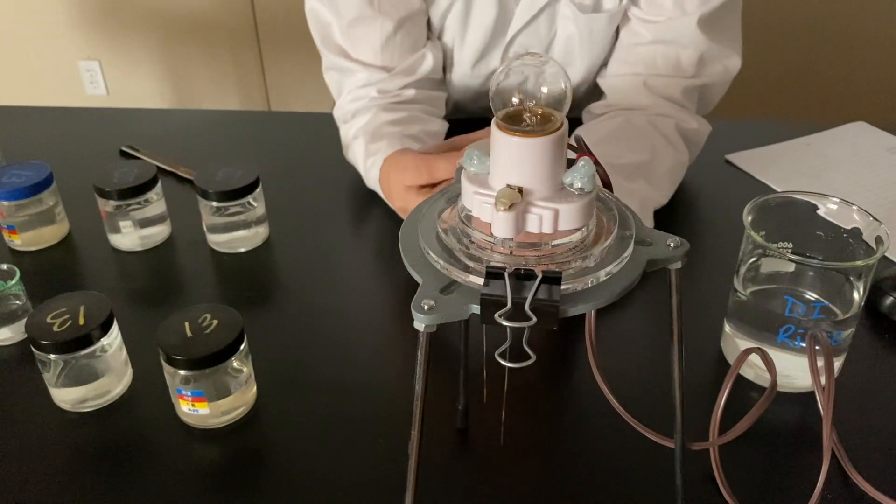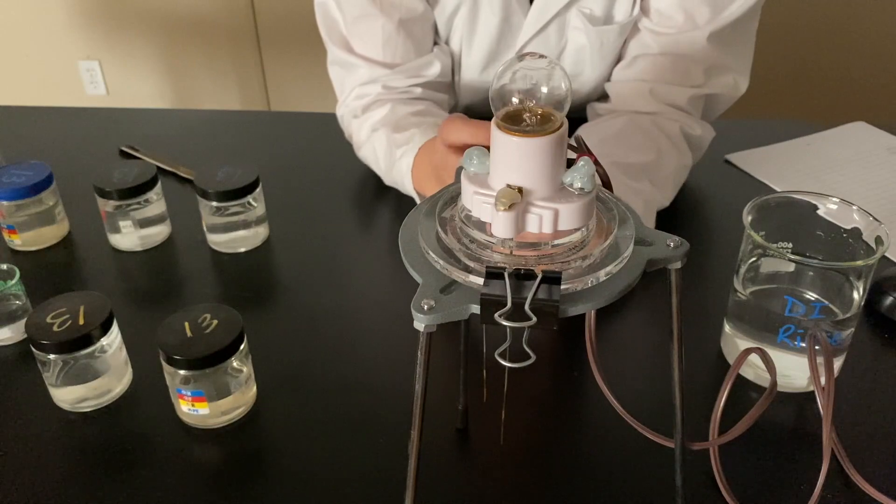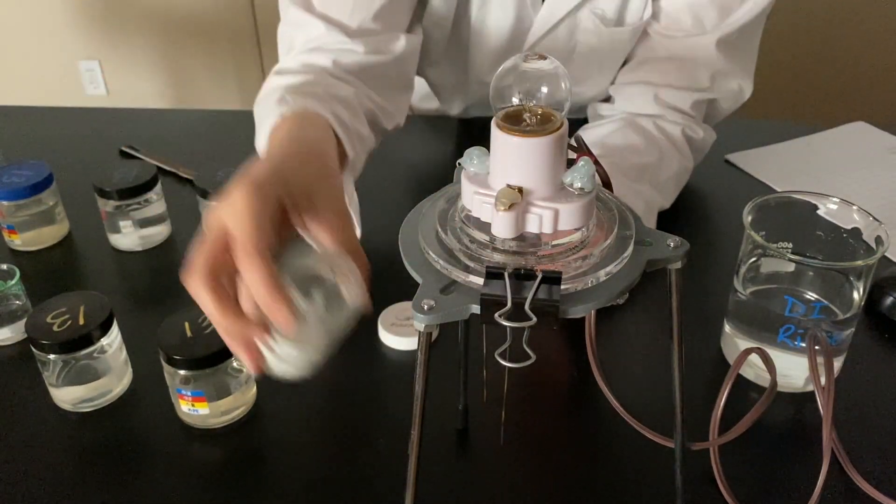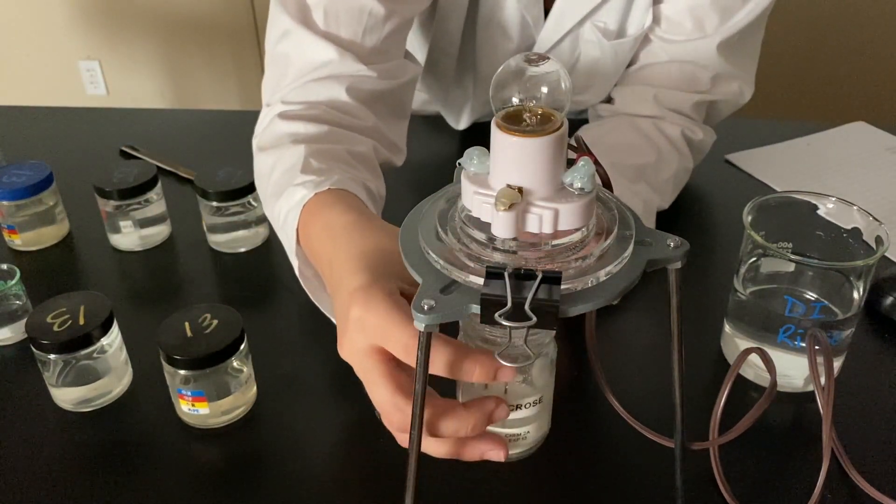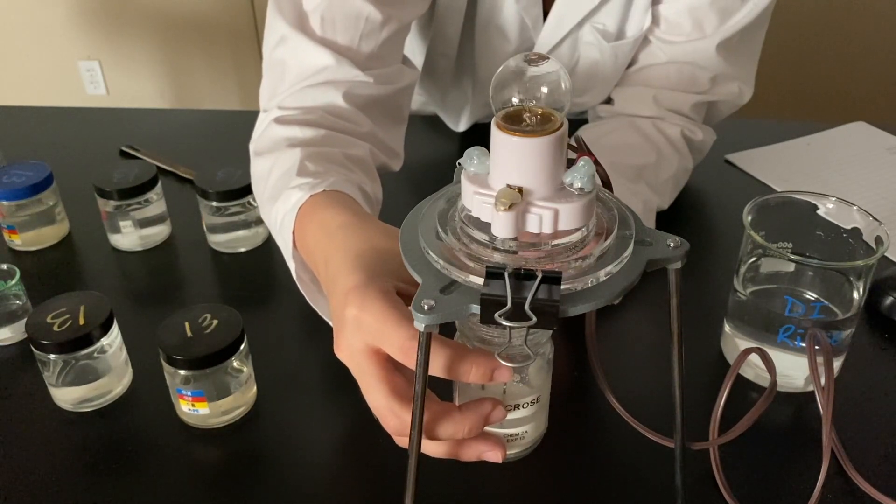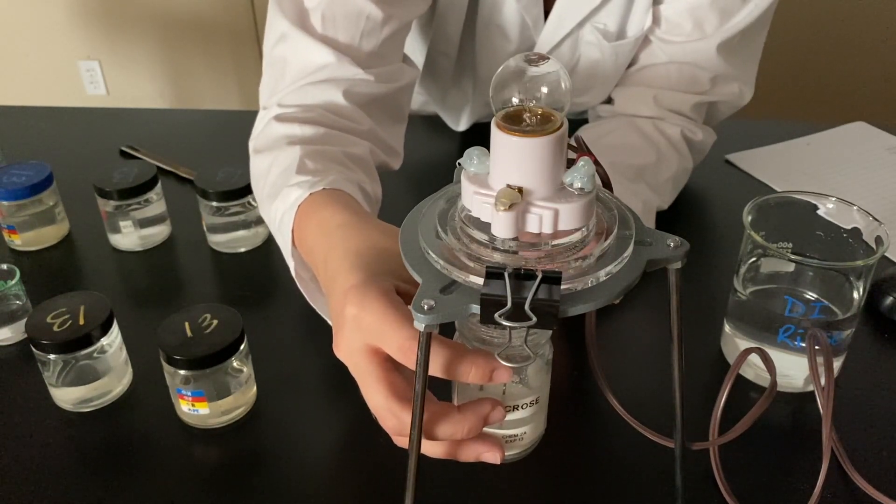Then we're testing sugar as a solid. So sugar as a solid. We're just going to stick those electrodes in and see what happens. Nothing.